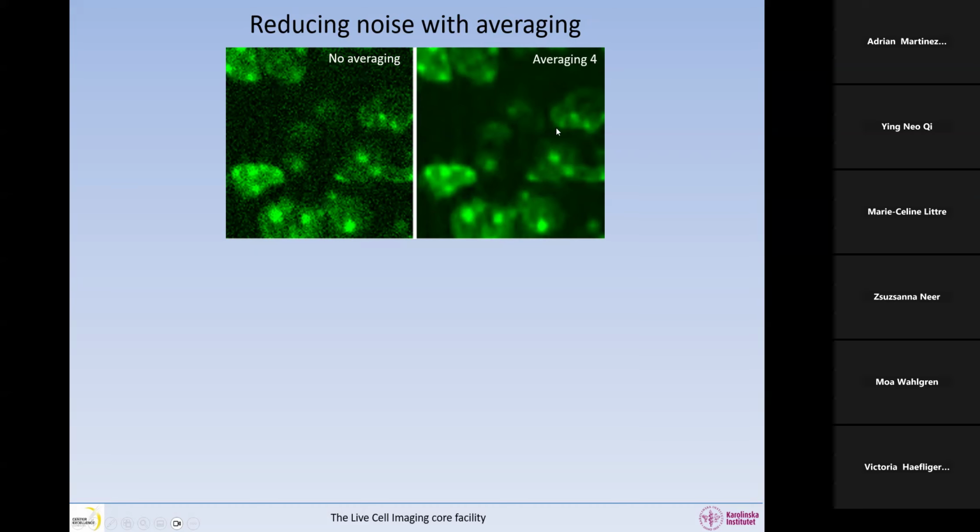And if we average 4 times, then we're going to get this type of image. The difference between this and that is that we have less noise, but also it's a little bit blurrier, right? Because it's averaged. So if we average 2, it means we're reducing the noise by half. What do we do when we average? We take 2 images, and from the 2 images, we take the value from each pixel, and we make an average. Because the noise is random, in the 2 images the noise is going to go to different places, and therefore it will end up being half.